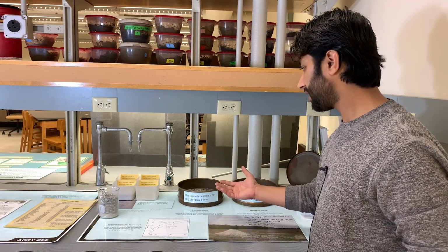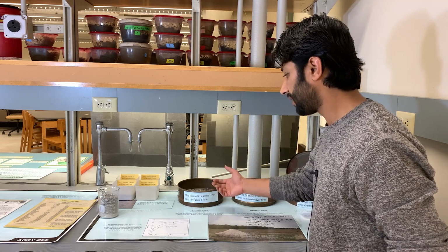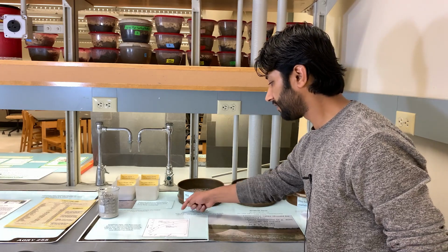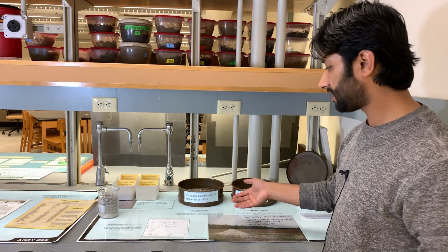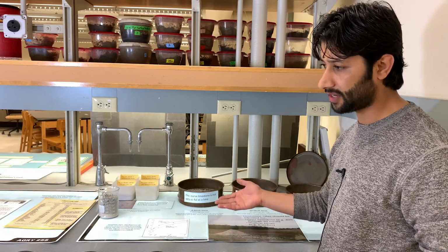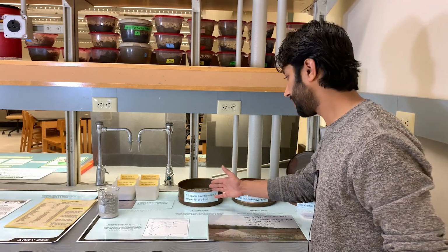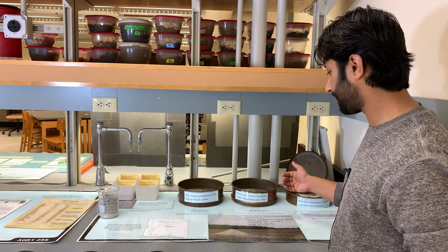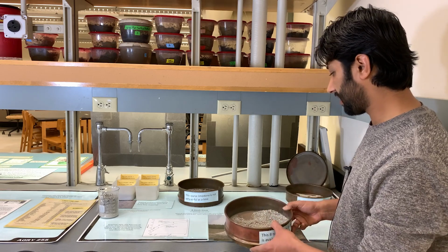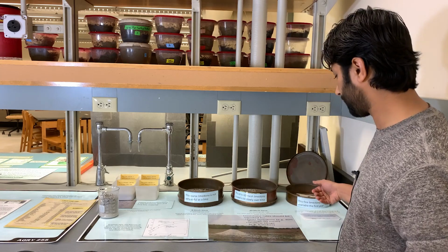So we had 1,000 grams of lime, and we put it through this 8 mesh first, and out of that 950 went through this 8 mesh, and only 50 just stayed on top. So in that case, the percentage is 950 divided by 1,000 times 100, which is 95%. So we already met one criterion, which is the 80% for 8 mesh. And then the second criterion is that 25%. So let's see how much went through. Out of that 950 right now, 636 stayed on the 60 mesh, and 314 went through.